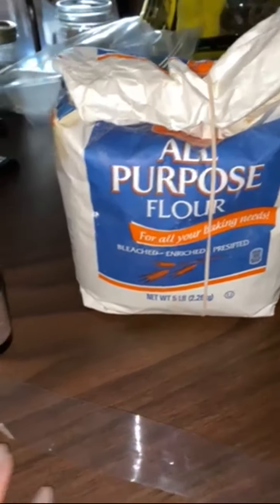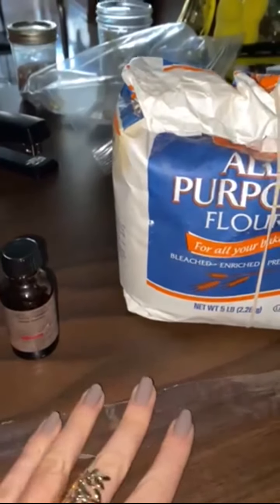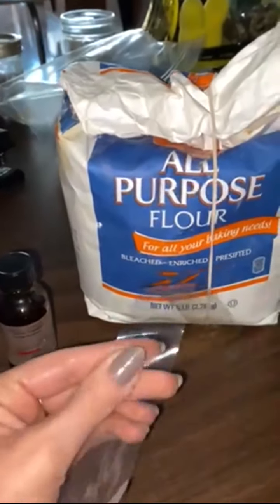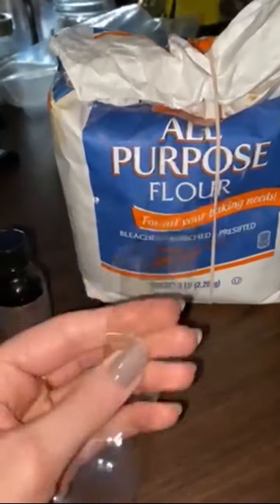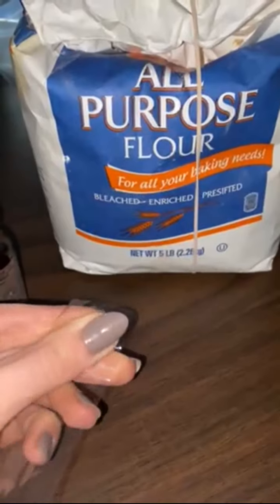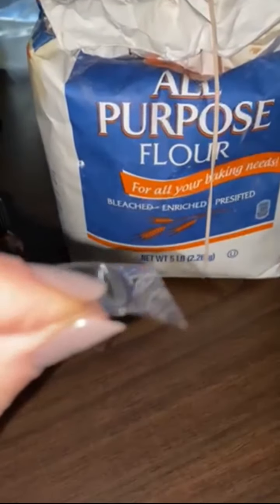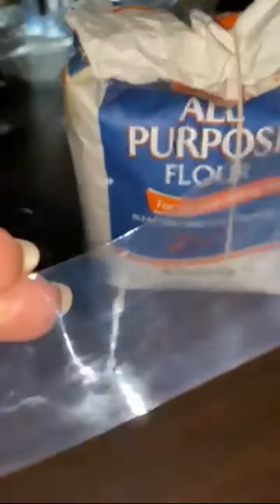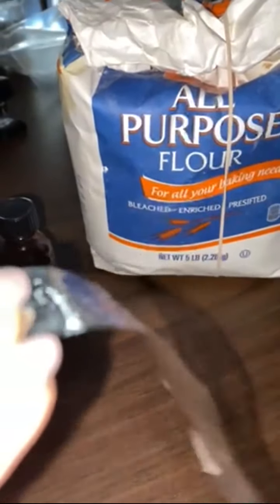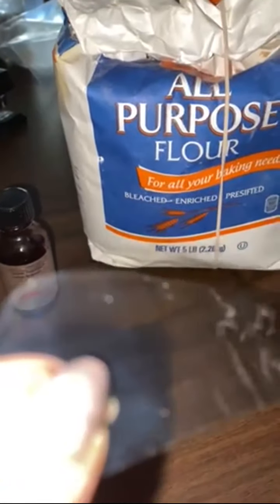To prepare for our little experiment today with diffusion, we're going to need a couple of simple things. We're going to need this tubing that we're going to call dialysis tubing. It is really just plastic, but when we pour water through there we'll be able to open this like an actual tube, and it has basically the permeability of a Ziploc bag or kind of like our cell membrane, where certain things can pass through if they're small enough, and anything too big won't be able to fit through the holes in the tubing.